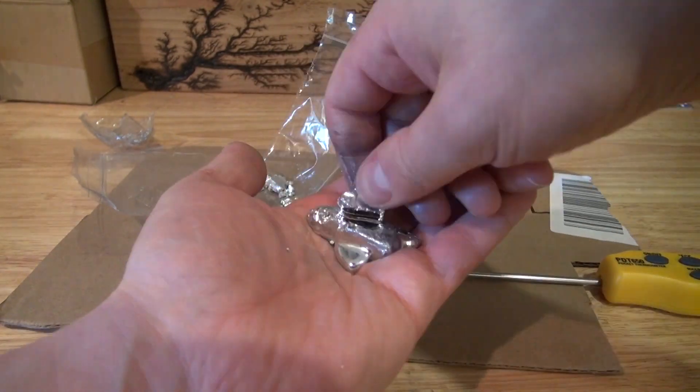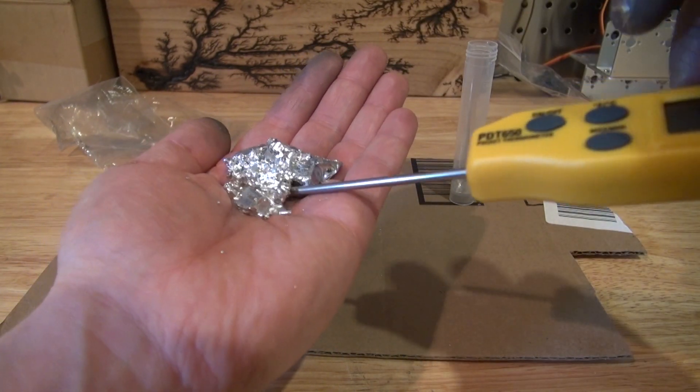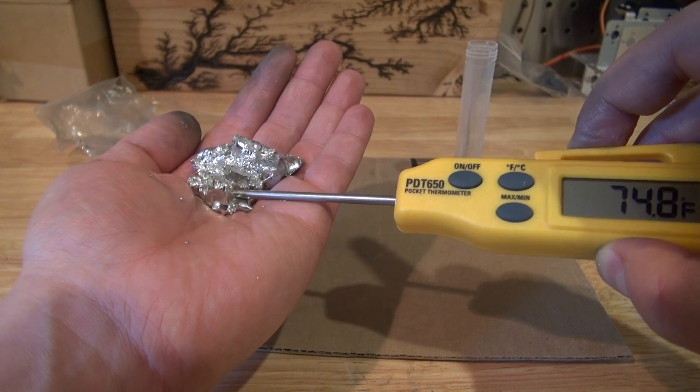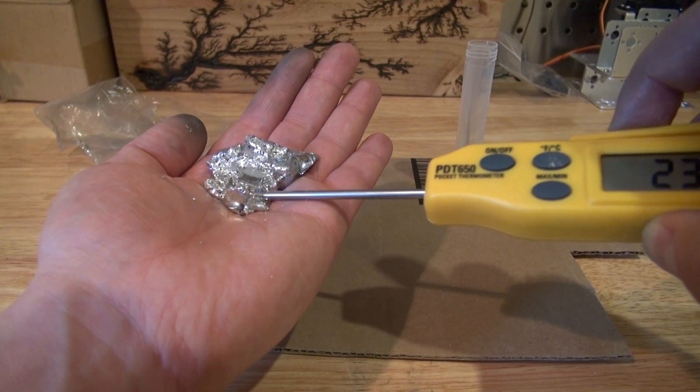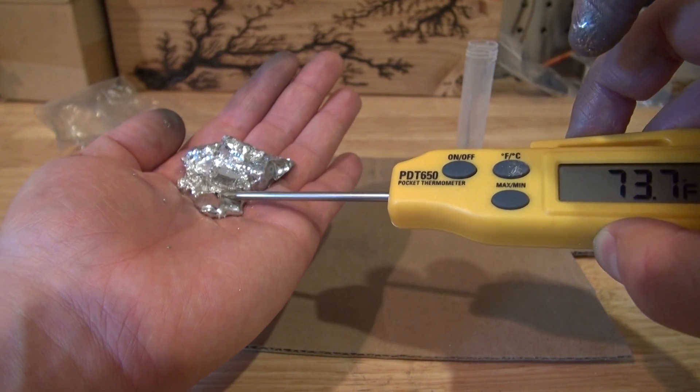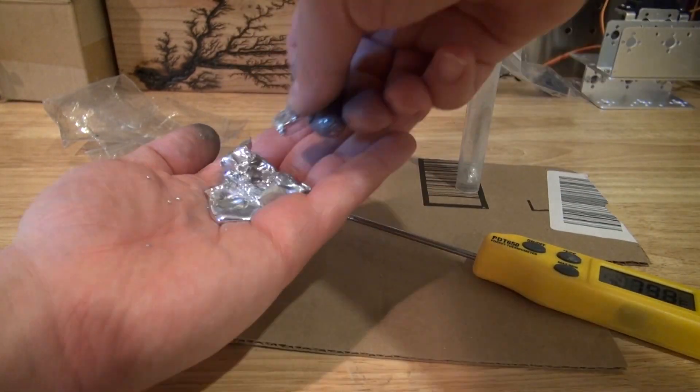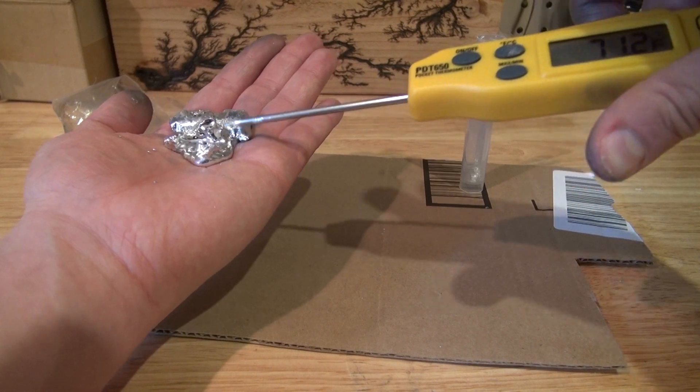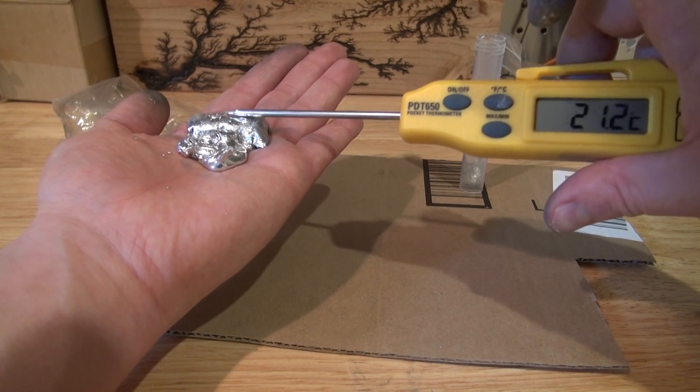Now let's go ahead and mix both of the metals together to form the eutectic alloy. Even colder and colder. Right here where it's the coldest. 23 degrees. 23 degrees Celsius, it dropped down 7 degrees. 21 degrees Celsius.